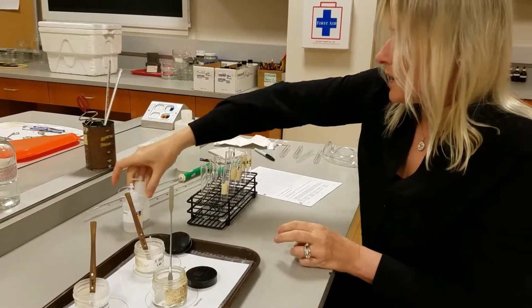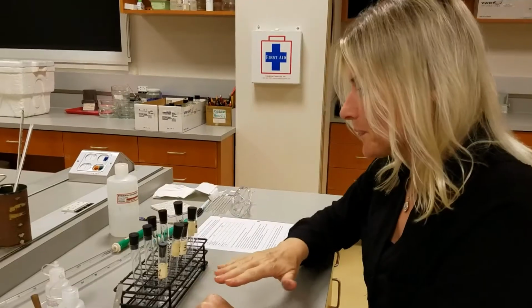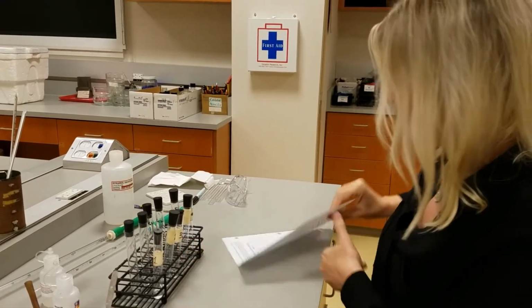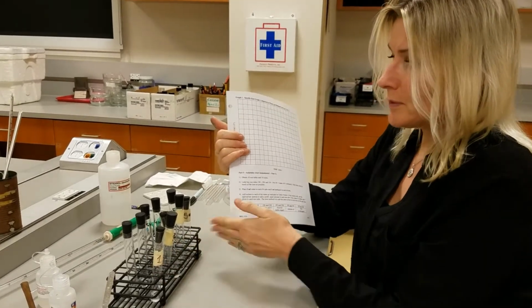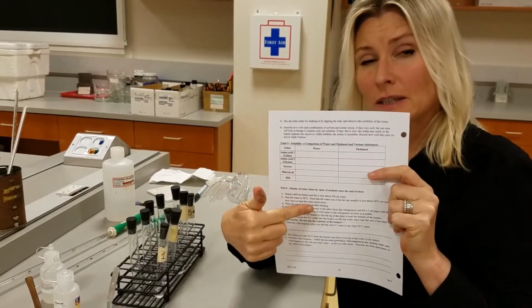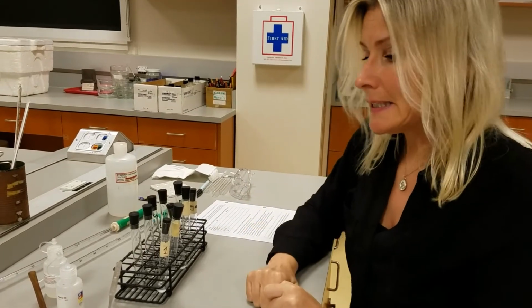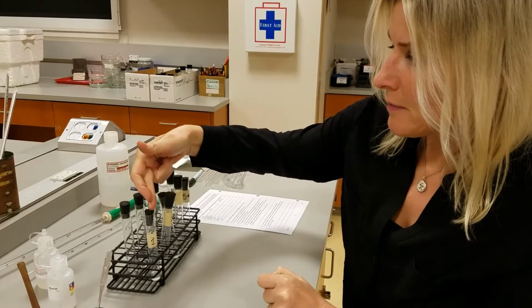Okay, so let's take a look at this and compare and see what happens. I have all the substances added according to this table into the methanol tubes and the water tubes. And so what we're going to do now is record our observation in this table, and we're going to try to really mix it. So let's start here with test tube 1, that we have water and methanol.